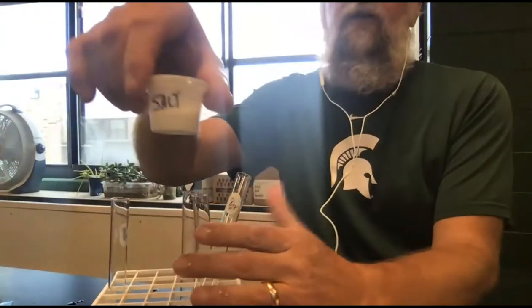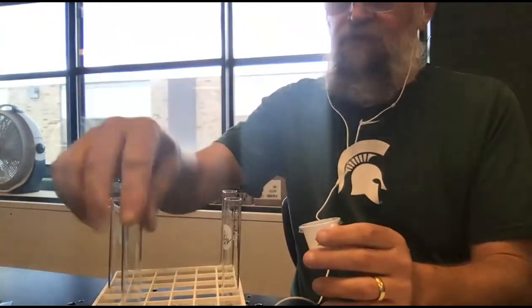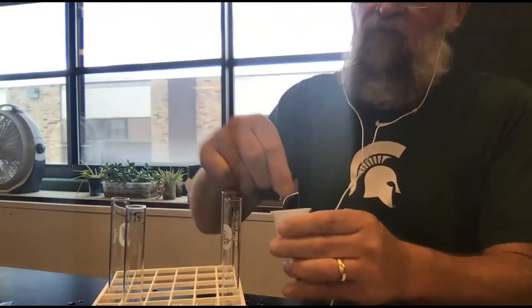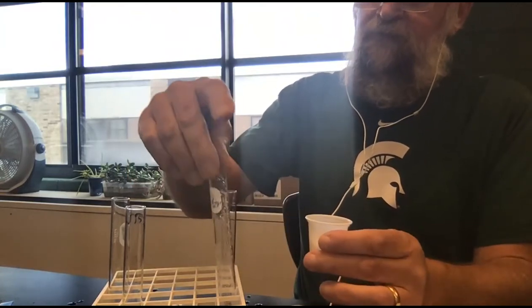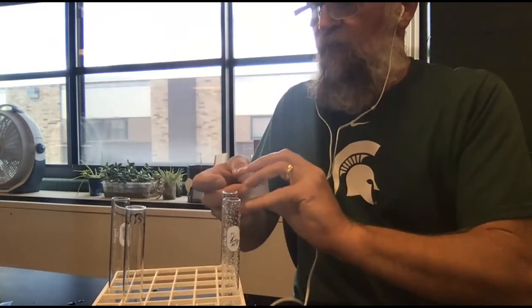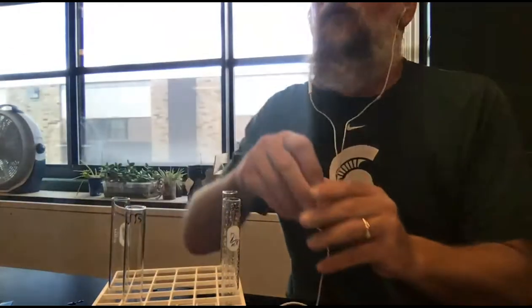So here I have some salt. And just to make it hopefully more visible, I'll put a couple pinches. Wipe off my hand. And I will put a couple pinches of sugar.